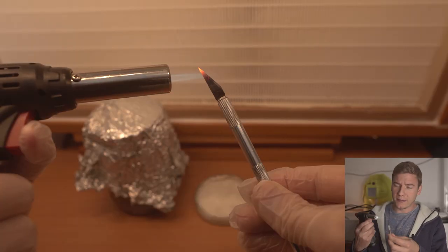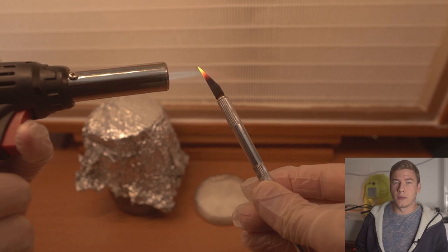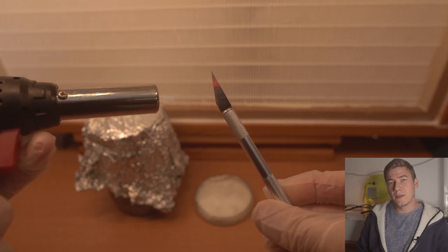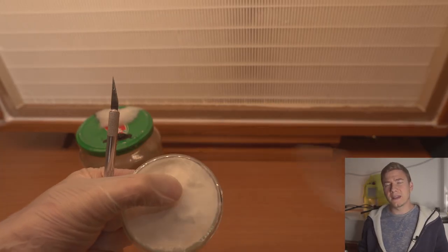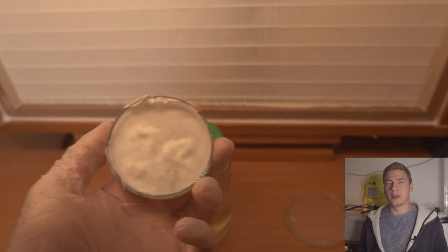So after we've sterilized our scalpel with a blowtorch, we're ready to go and scratch the mycelium from the agar plate and add it to our honey mixture. I've repeated this step like three times just to accelerate the process of mycelium growing in the honey mixture.